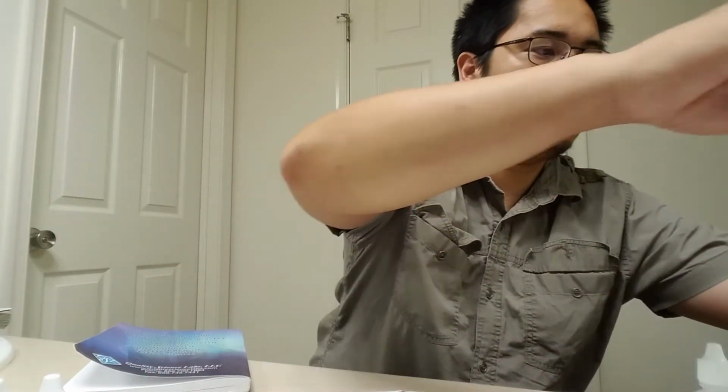Cool. Now the most important thing is the cleanup. Again, this is a very, very diluted concentration, so I can just dump this straight inside of the sink, but I use lots and lots of water because I don't want to do anything bad for the environment. And then what I always like doing is, where's my, there it is.